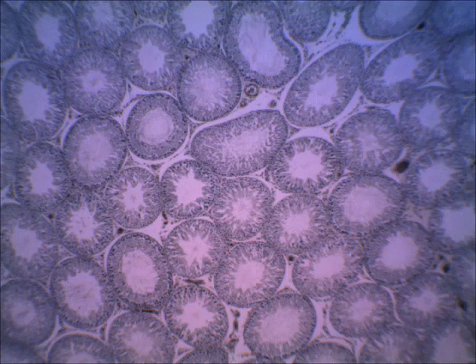In this set of slides, we'll just be looking at the testis slide. So it's the only male reproductive organ you'll be studying through the microscope. On this first one, what you're looking at is the inside of one of the lobules in a testis.